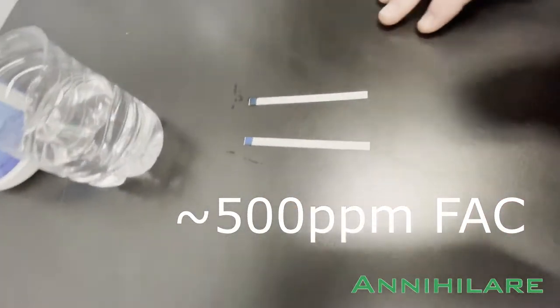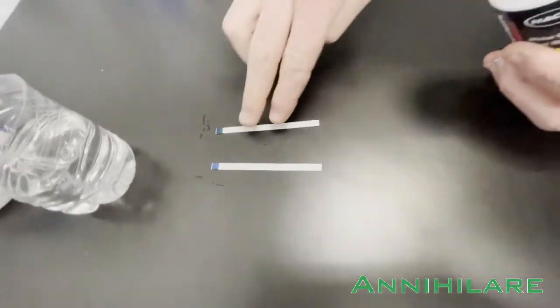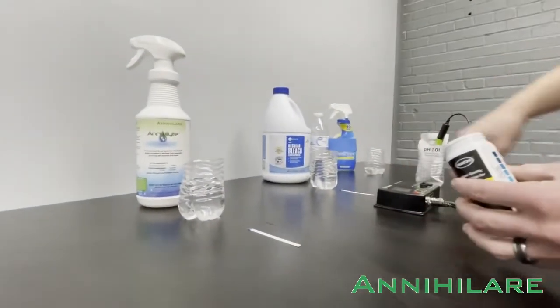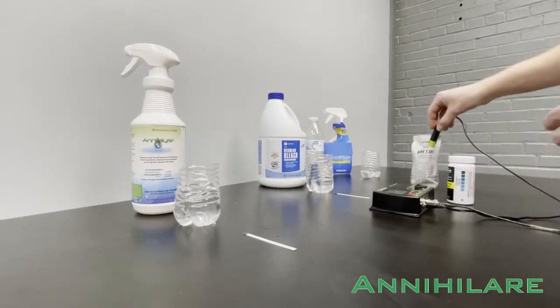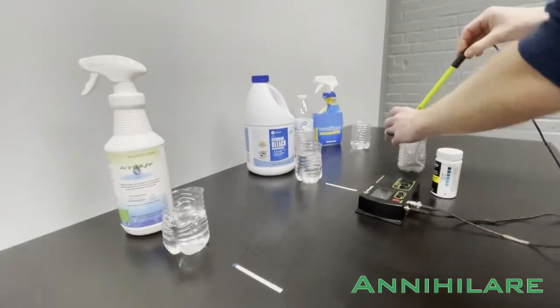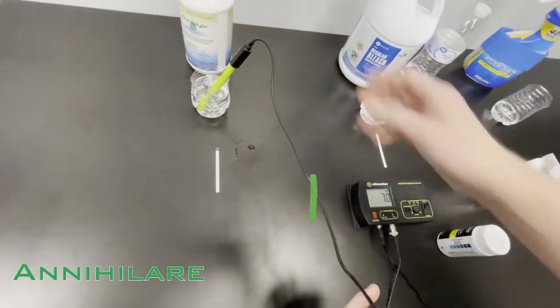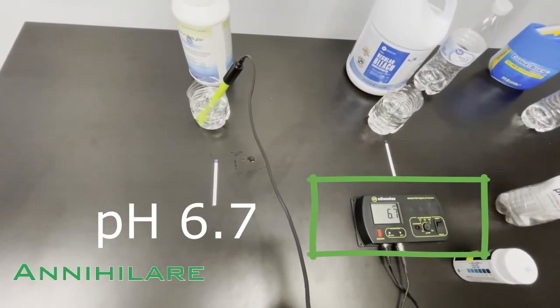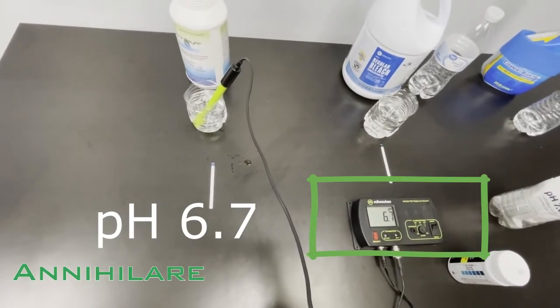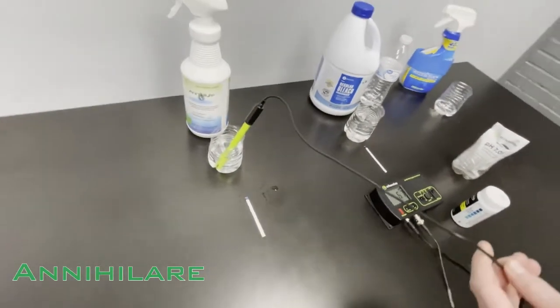If you compare the two strips, I'll slide that over here. Now we're going to show the difference and it's going to be the pH value. I'm going to take this probe and start with the hypochlorous by dipping it in here. If you can see the pH value, we're landing on about a 6.7 which is pretty darn neutral.